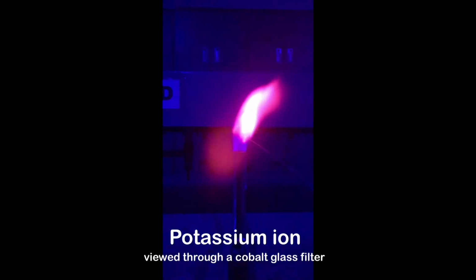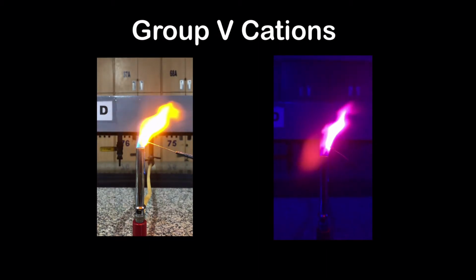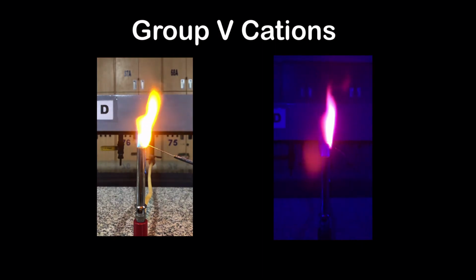For the detection of potassium ion, we use a cobalt glass filter to expand our ability to see the violet flame. So once again, these are the results for the flame test of the group 5 cations. Again, experience is very much necessary in the identification of the colors of the flame, so I suggest that you keep on reviewing this video for mastery.